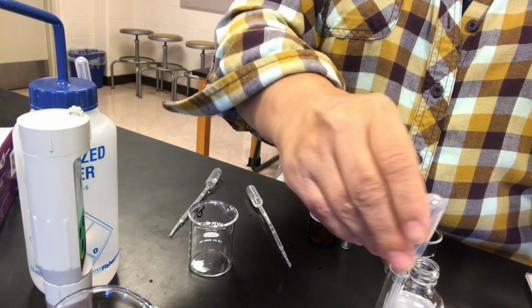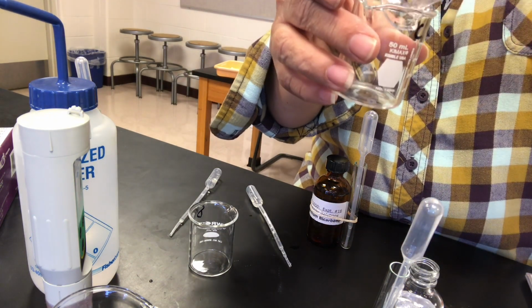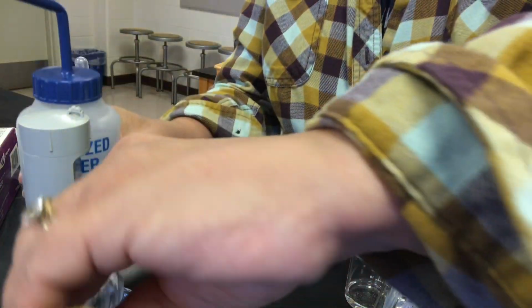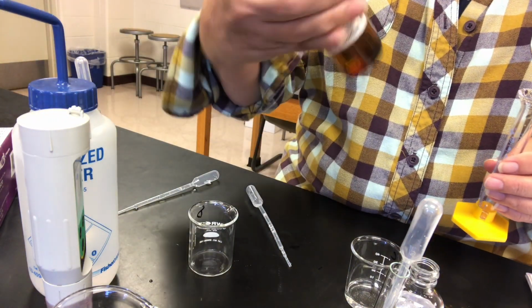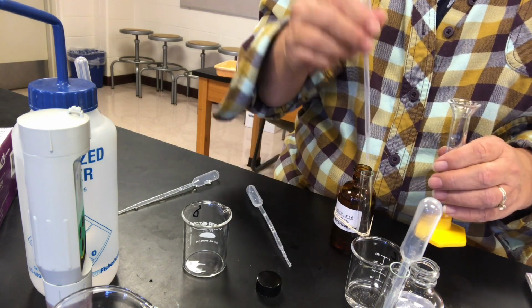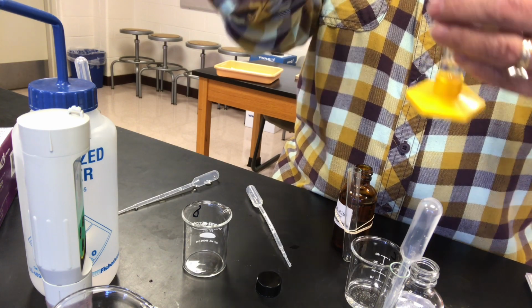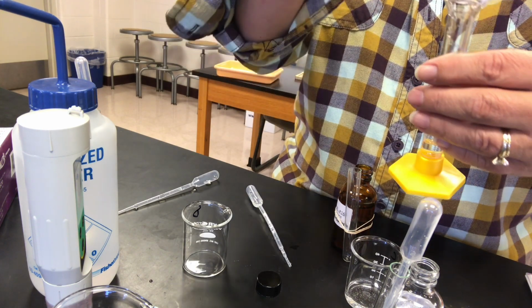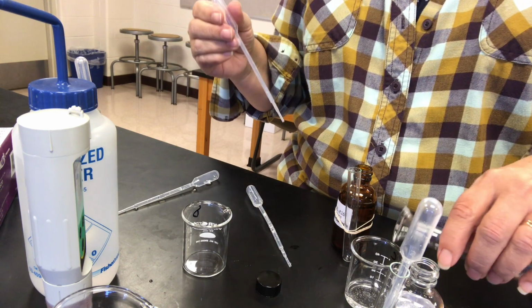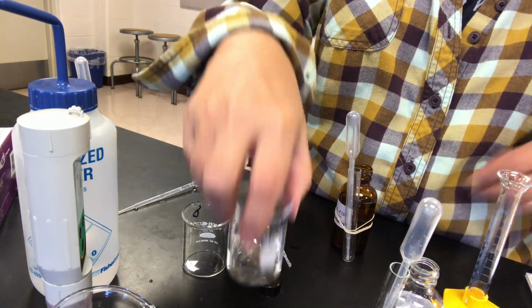So that's going into beaker C, 5 milliliters. Then the sodium bicarbonate will also be 5. So in this case, I'm making a buffer that has a 1-to-1 ratio of conjugate acid to conjugate base. They're both the same concentration, and they're both going in at the same volume. So that ratio of conjugate acid to conjugate base will be 1-to-1 for beaker C.